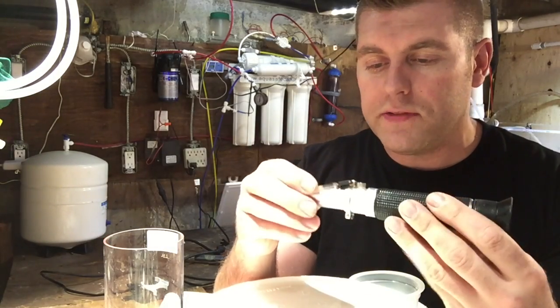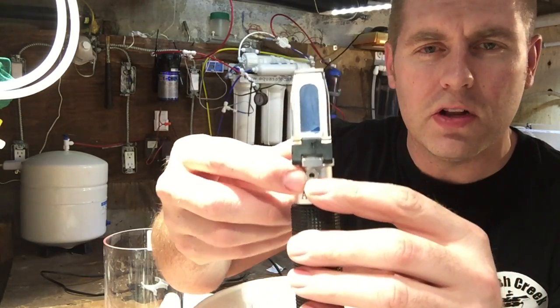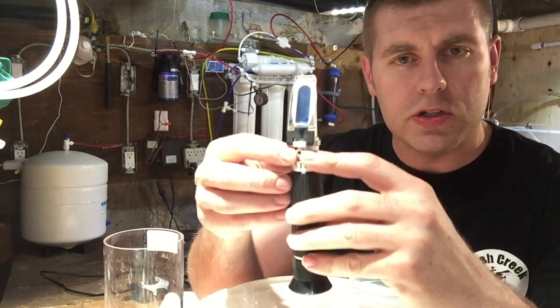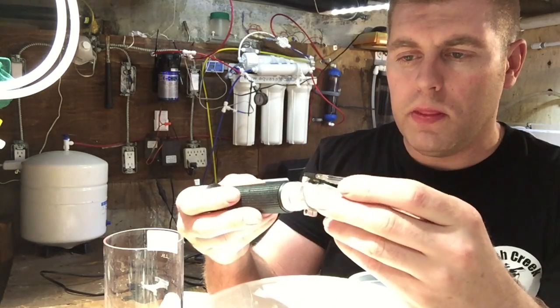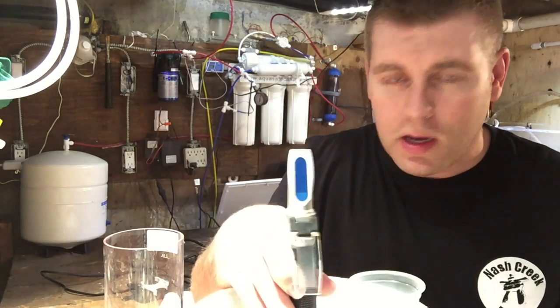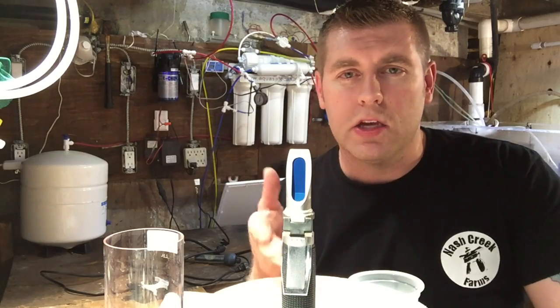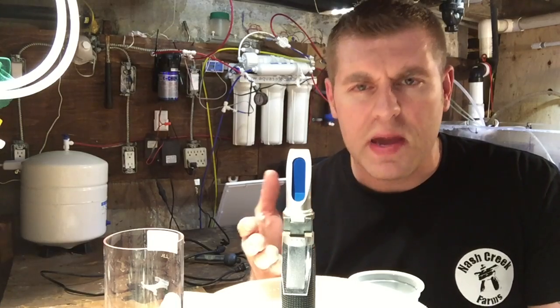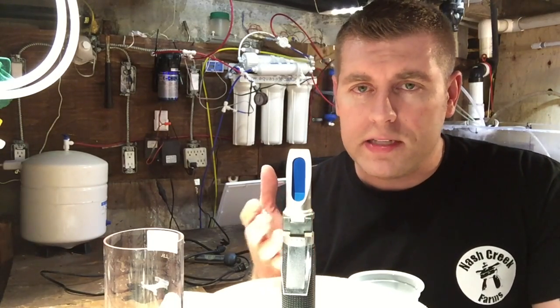Make sure you clean it up perfectly after you're done, and calibrate it as soon as you get it out of the box. That calibration screw uses a mini screwdriver — like a glasses screwdriver — and it usually comes in the little kit along with a sample of DI water. Keep everything clean. I love this unit; it's definitely worth the money. You can find them online for around $30.